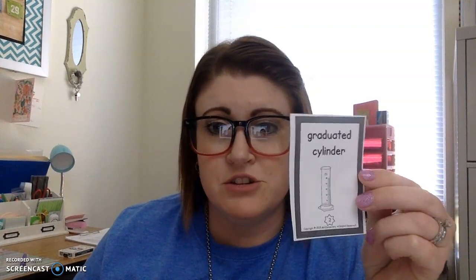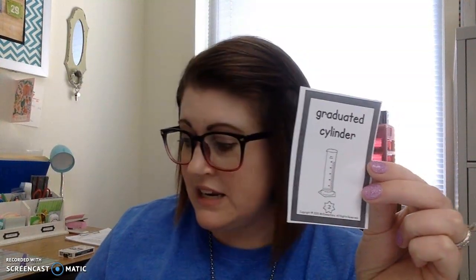Hey, third grade, I wanted to go over some science tools with you guys. You might see these tools a little later on. So the first one I'm going to show you is called a graduated cylinder. A graduated cylinder is a clear tube-like thing, and it helps measure liquids or powder.